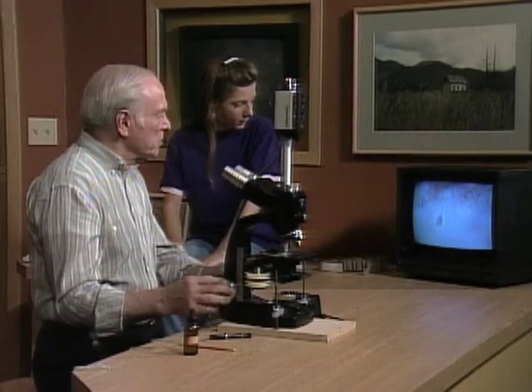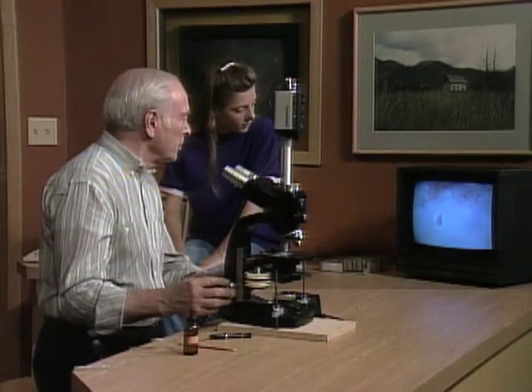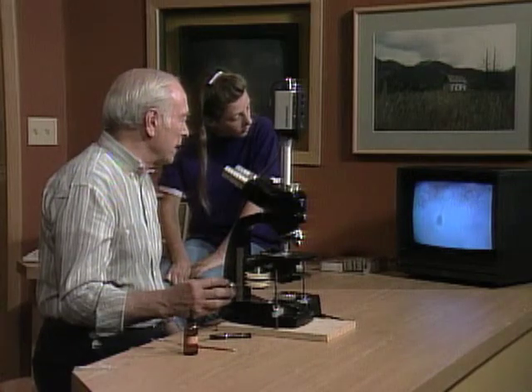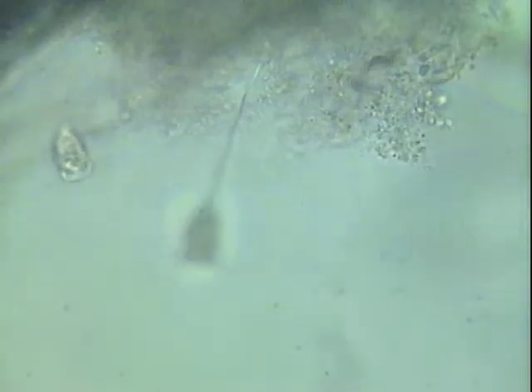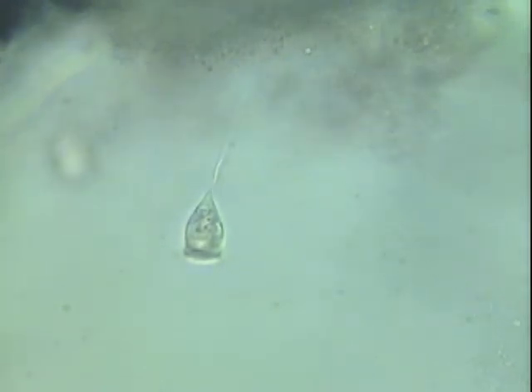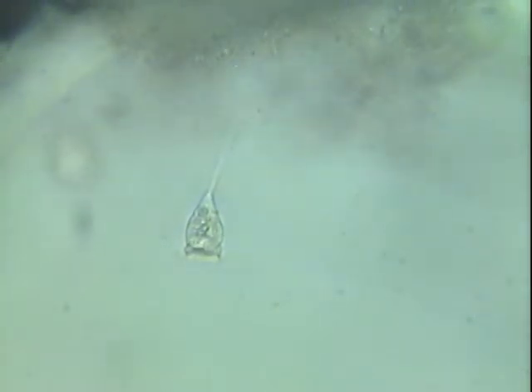Here's another superstar of the microscopic world. See up near the top, there's a stalk, a little string coming out. I'm going to focus down that string so you can see what's at the other end — and there it is. You might think it was a plant because it's anchored.